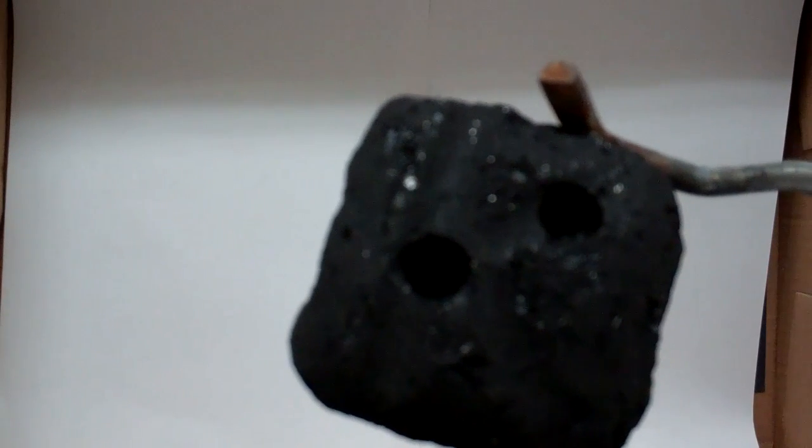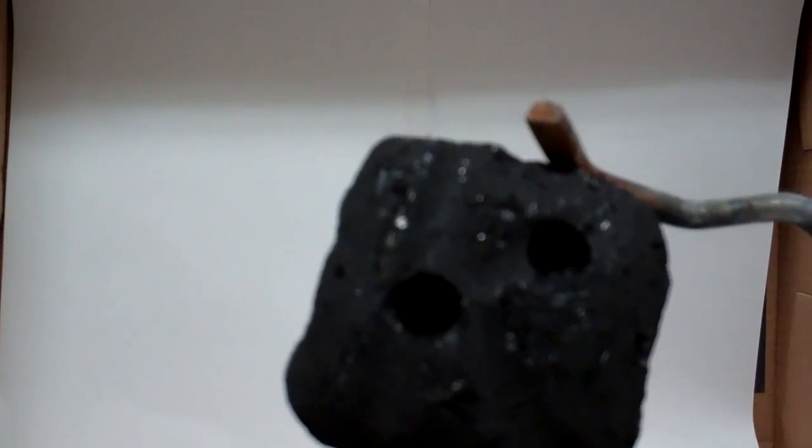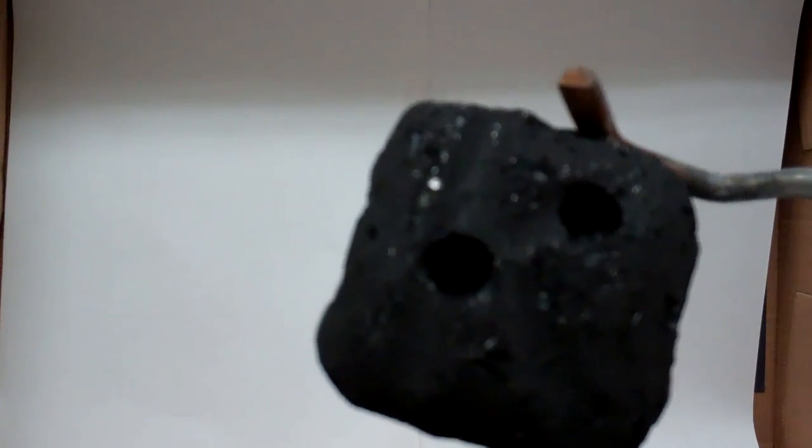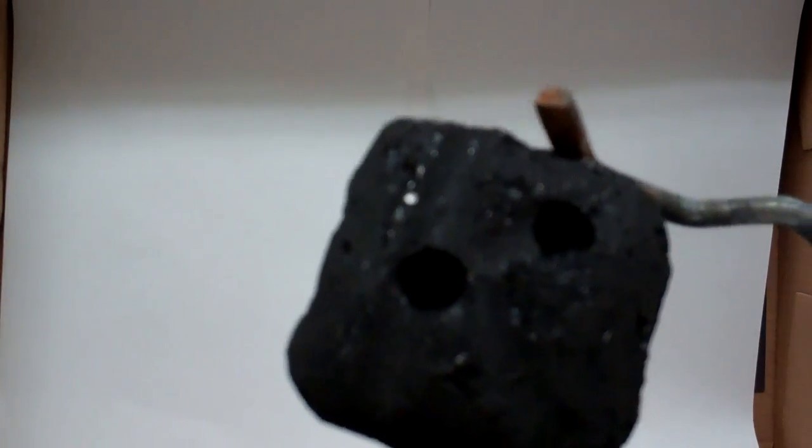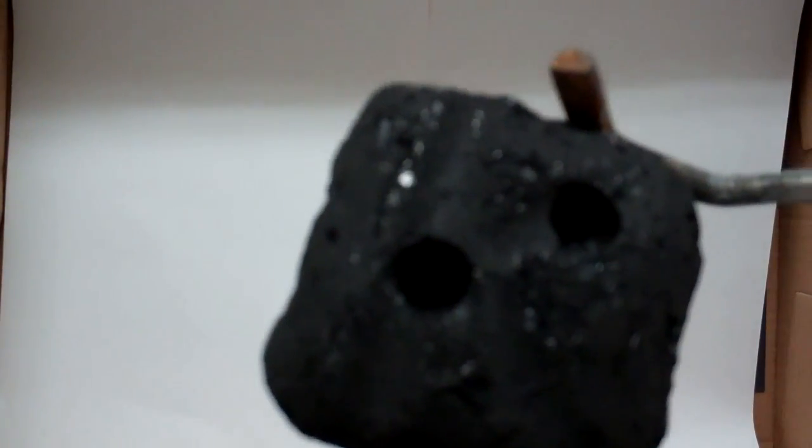They do need to have some space between them. That way when you do your reactions in these holes, they won't leak into the other hole and contaminate that reaction site. So for this cobalt nitrate test, we are actually going to be doing the test inside this charcoal briquette.